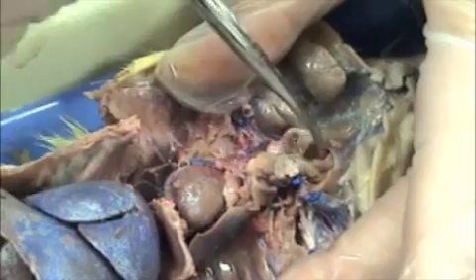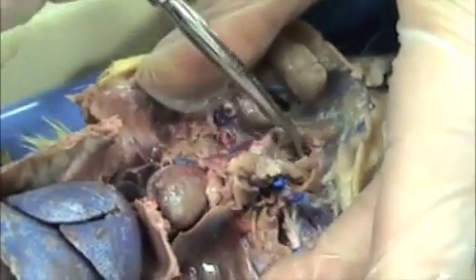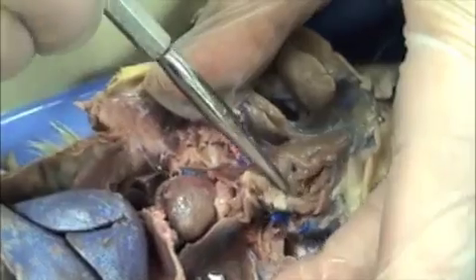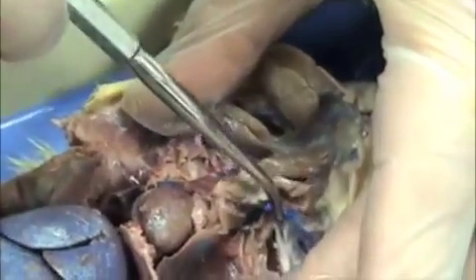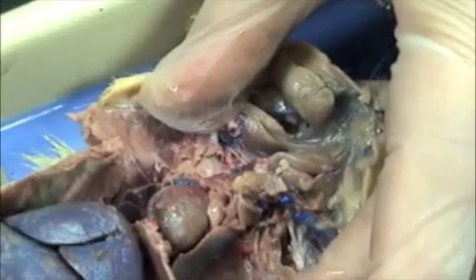If you come up to the neck region here and dig enough, we'll find the trachea on another one.